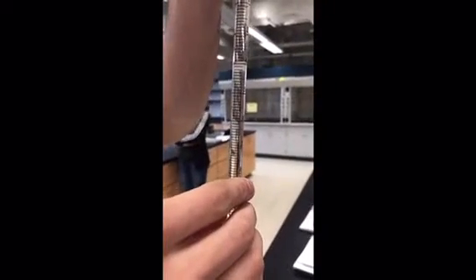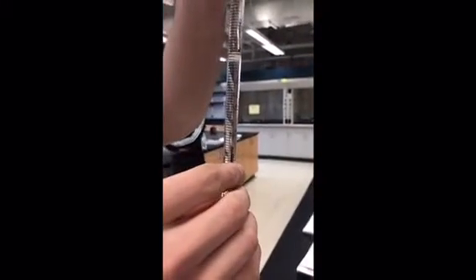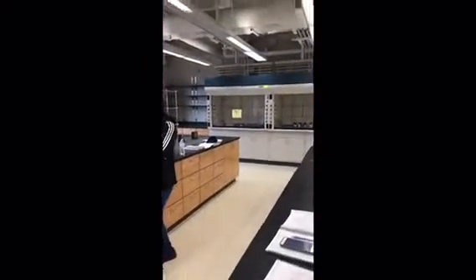When determining which value to use on the screen, choose the one that appears the most out of the changing numbers. Here is an example of the meniscus in a pipette. As you can see, it's where the solution concaves. When wanting to find a measurement from the pipette, look at the meniscus and the line it forms.